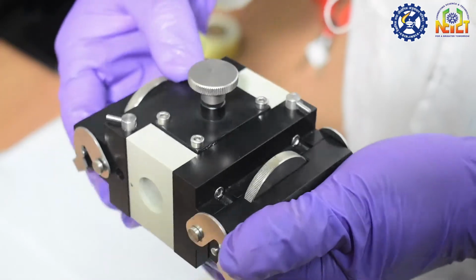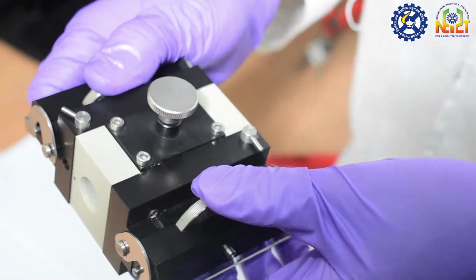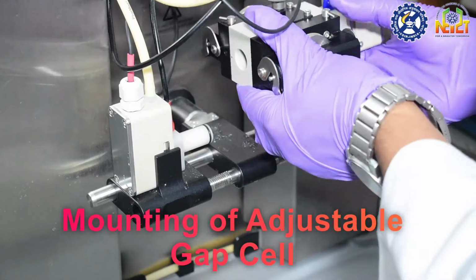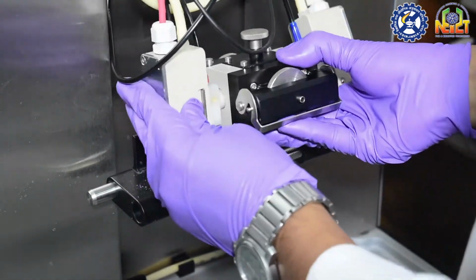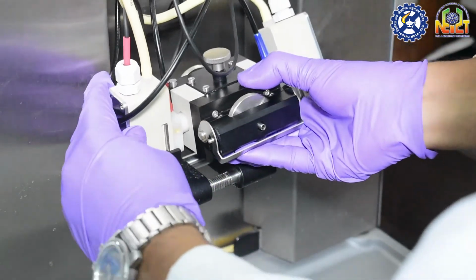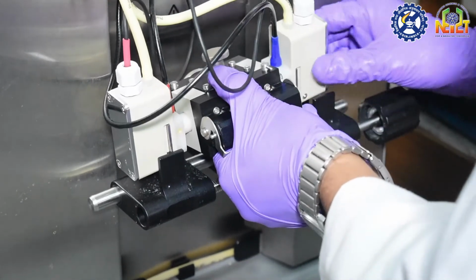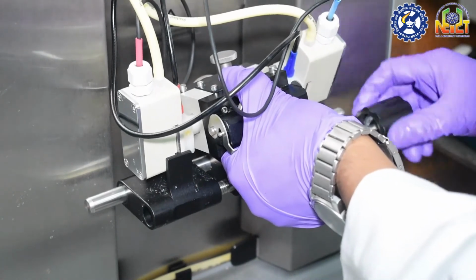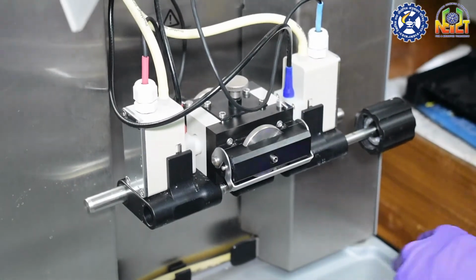Now we have to compress the silicone sealing block with the knob and then tighten the knob gently. Now we can mount the surface measuring cell holder with its adapter on the dovetail guide at the front side. Take the surface measuring heads and insert the electrodes in the bore holes of the adjustable gap cell. Adjust the distance between the measuring head brackets of the cell holder with the knob according to the distance between the surface measuring heads mounted in the adjustable gap cell.